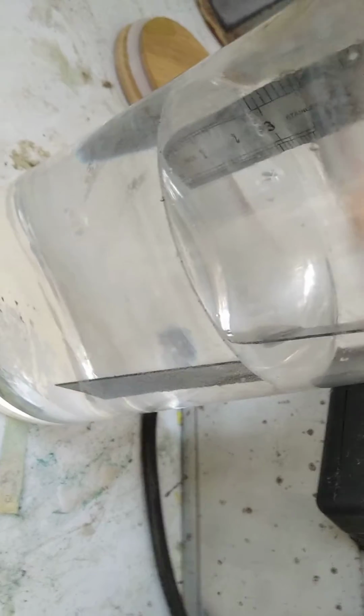And over here, yeah, this is on stainless steel. The idea is that this would be much better than titanium, because titanium is, I mean, it's not that it's hard to get, it's that the process of electroplating titanium requires the use of fluoride and HF, and if I can get away with this stainless steel, which means that I don't even need to, you know, I just use hydrochloric acid or even just electrochemically etch it with salt water before plating, it works just fine.